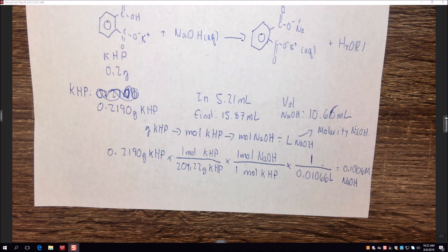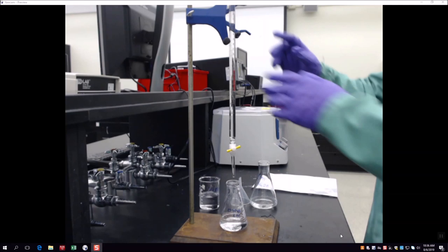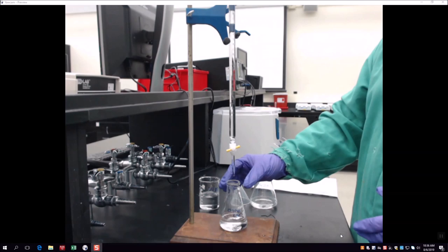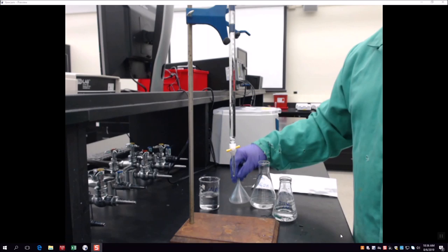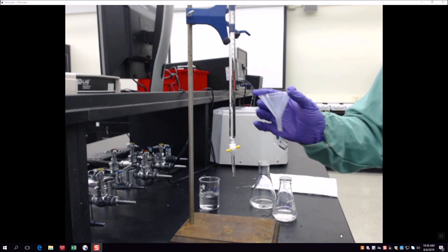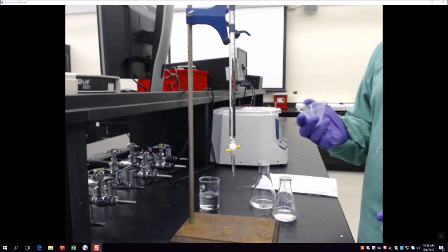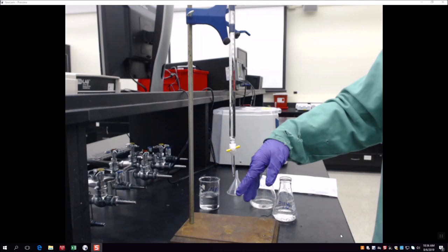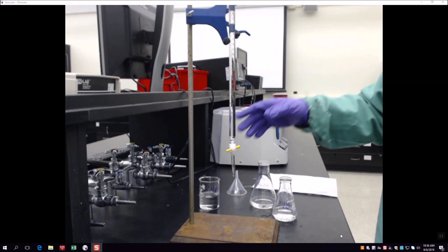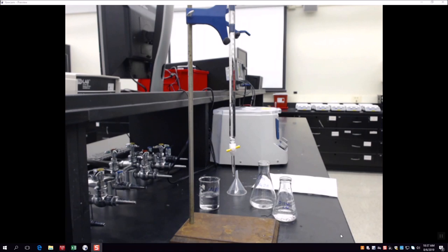Tim will now show you how to physically perform this titration. To set up a burette, get one from the drawer, rinse it three times with water using a small funnel, then rinse with NaOH solution twice before filling it. Use a waste beaker for draining. Keep the waste beaker underneath the burette while it's sitting so no errant drops make a mess.